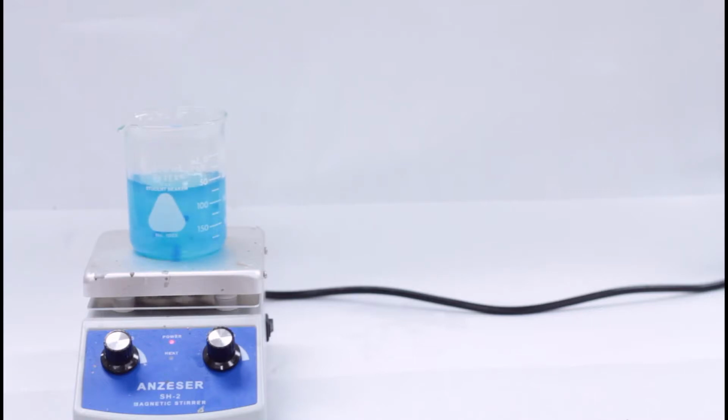In this lab, we will be creating and using two reagents that are used for analyzing different types of organic compounds. Both of these reagents are solutions that contain something called a coordination complex, but that's a fairly advanced idea that we're not going to get into in this class. What we want to focus on is the fact that these are both solutions.